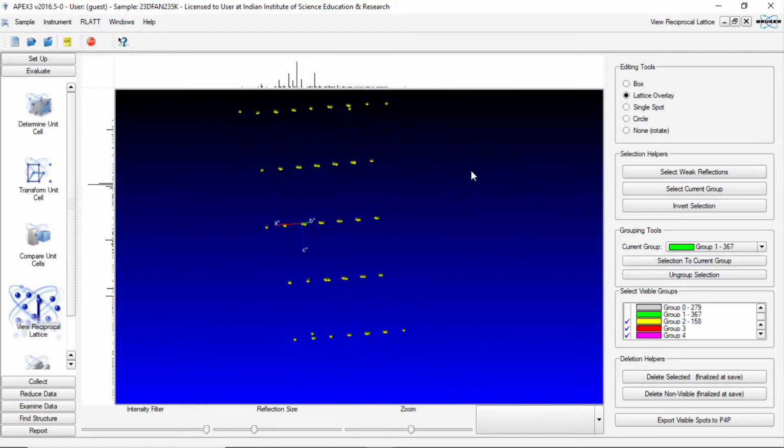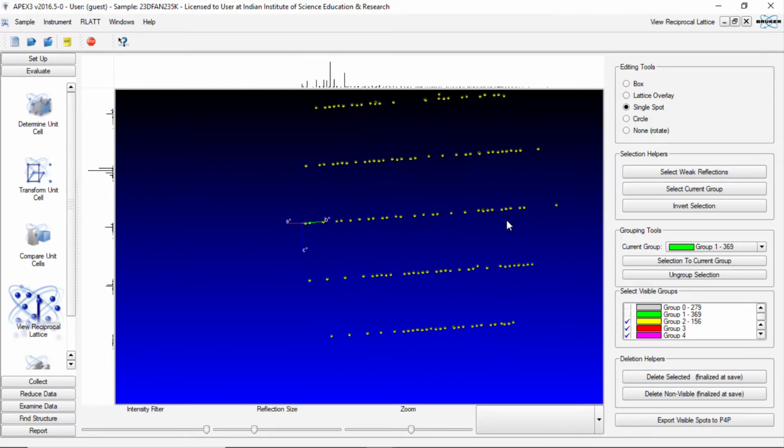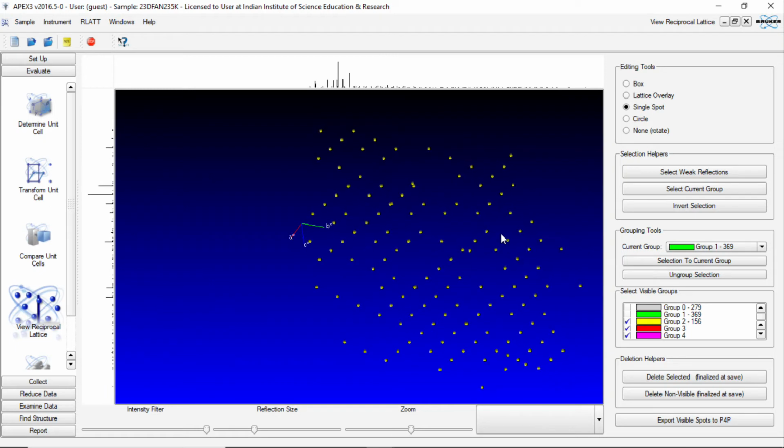So now we have two sets of reflections. One is yellow, where still we see one reflection is not in line. A single spot can be selectively removed. This one can be selectively removed. And we look at these in different directions to see if there are any unaligned reflections, which is here. These reflections that I am removing are not parts of any of these two sets, the yellow set and the gray set.